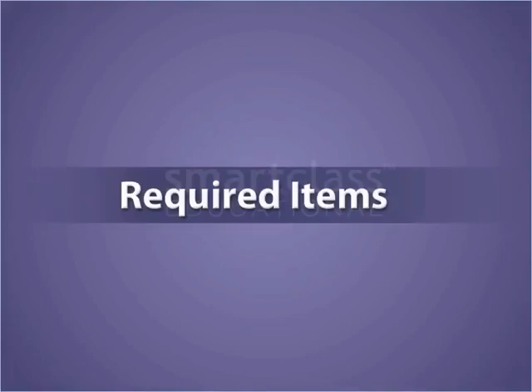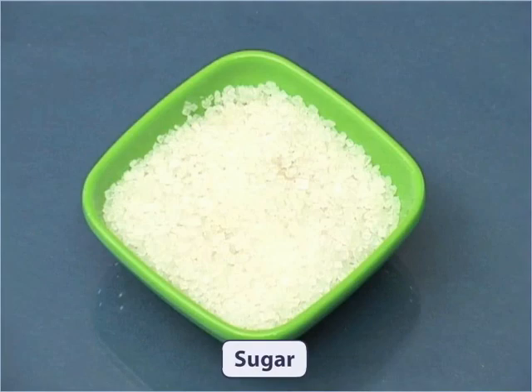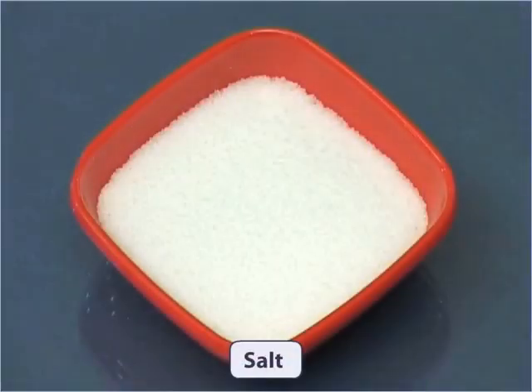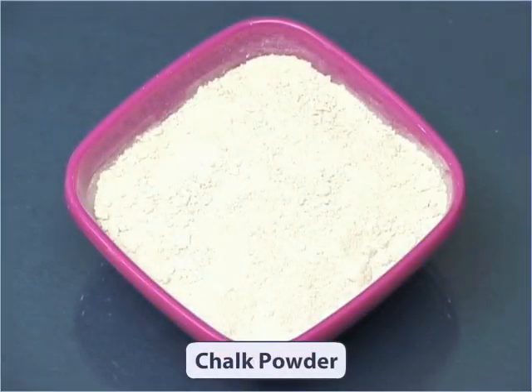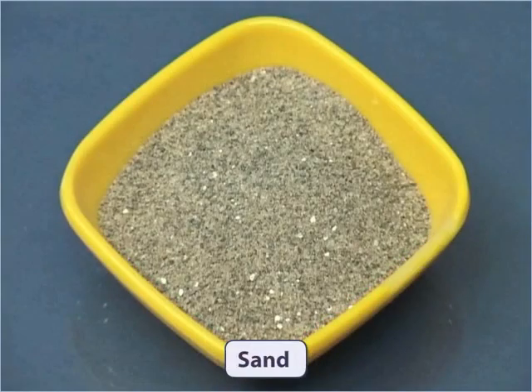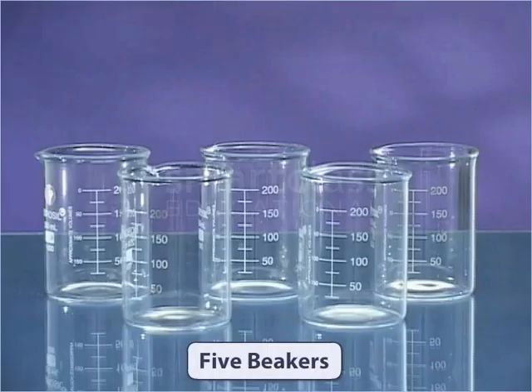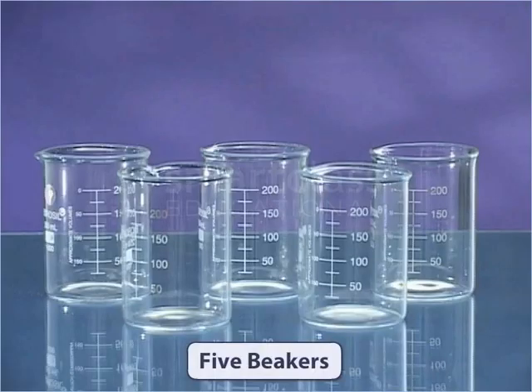Required Items. For this activity, we need sugar, salt, chalk powder, sand, sawdust, water, and 5 beakers.